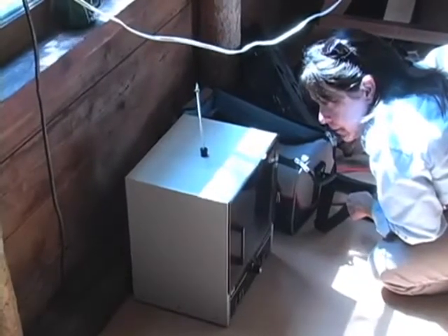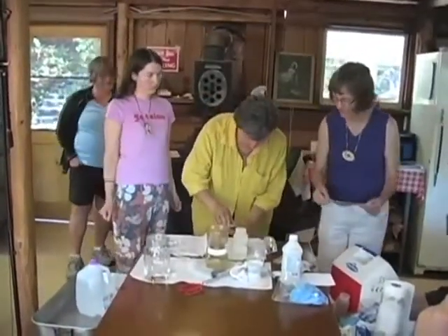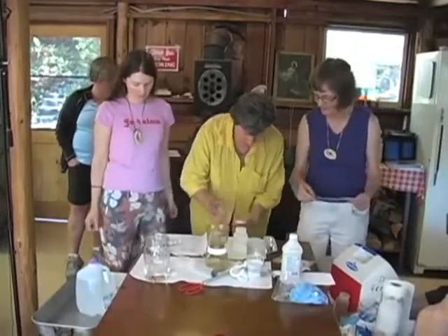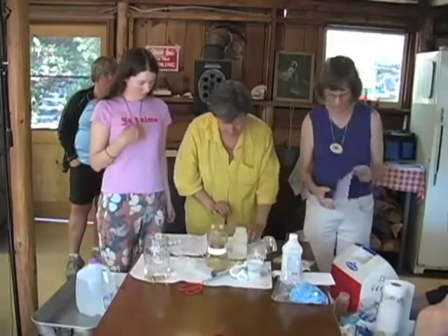So what we're going to do is open that and pour it in on there, so you don't touch the inside. That's correct. Just like that. Very good. Now good. All right.